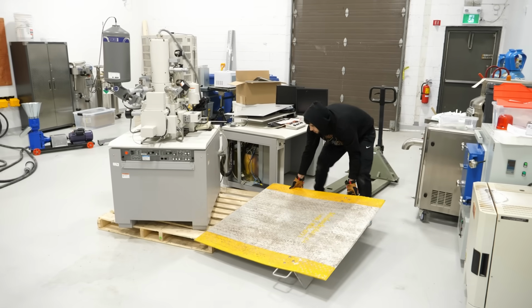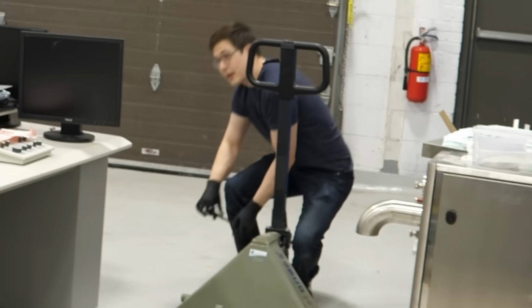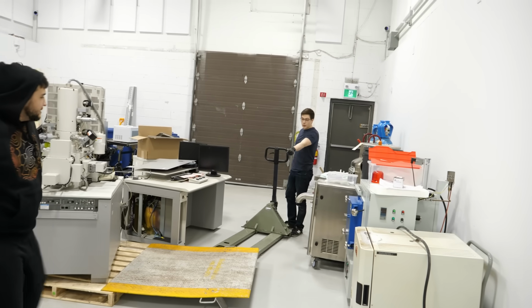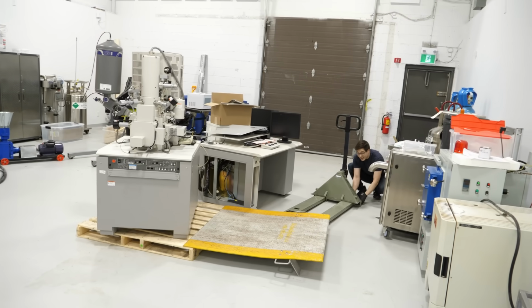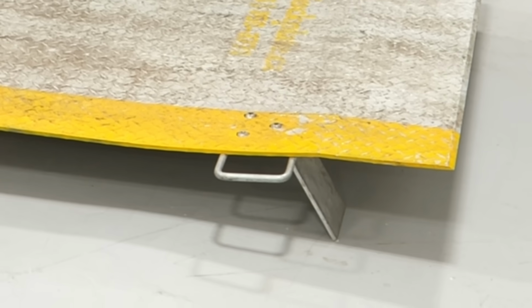Okay, this is not a good idea. This thing weighs potentially close to 1,000 pounds. Estimated 500 to probably 700. Merely assuming that these random pieces of metal that are on an angle are gonna support it. I mean, the real solution... What if we put the tungsten cube under there? We can just take these things off. Look, they just come off.